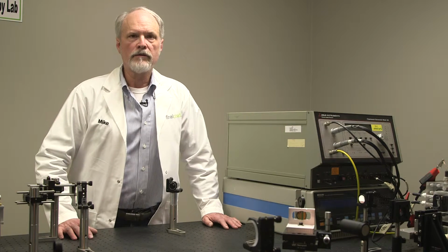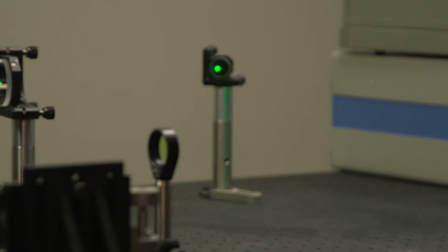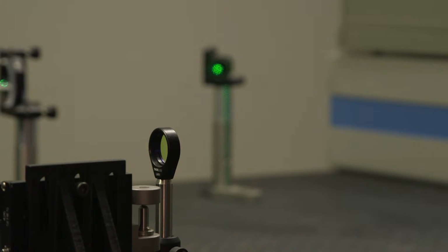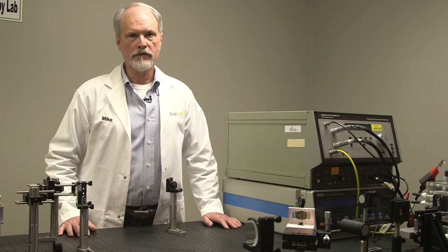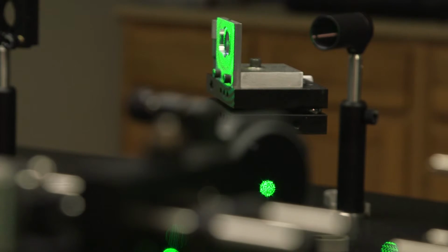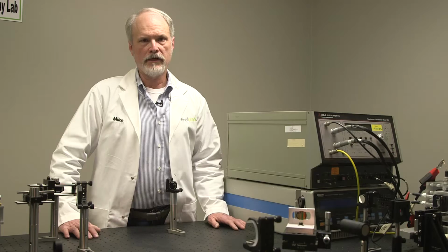Now, the way that the Raman spectrometer identifies a molecule on the surface of a piece of metal is rather clever. What you do is you shine laser light of a very, very fixed narrow frequency from a laser source, which is over here to my right, and you look at the light reflected from that surface.